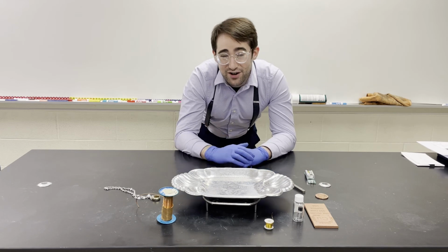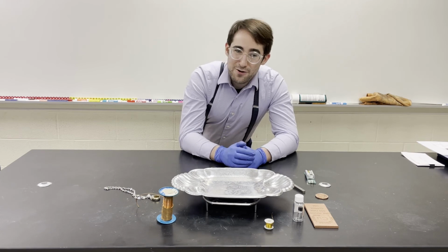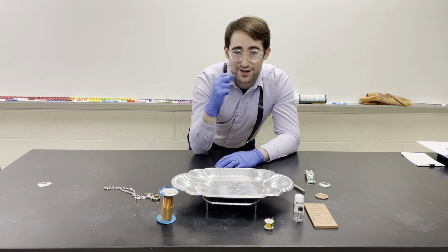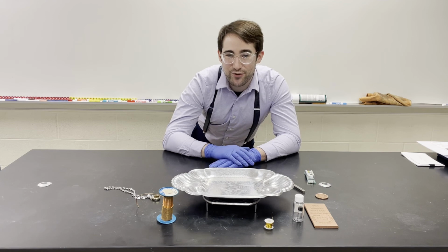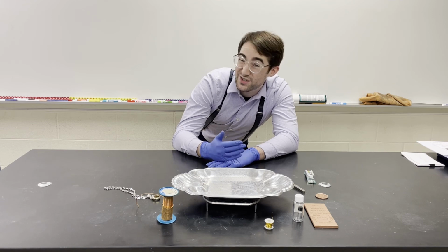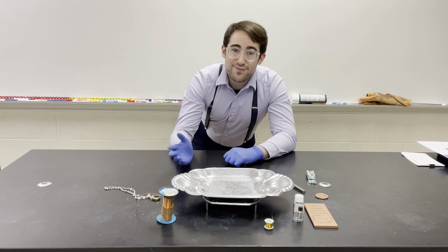Okay, so that means any jars that are open are fair game, as long as you have gloves on. Most of these metals are okay to touch with your bare skin, but there are a couple that are not so much. So we want to minimize contact as much as possible, which is why we're going to be wearing gloves the whole time. So in the lab, you're going to be looking for properties that are characteristics of metals, or stuff that's characteristic of nonmetals, or things that are kind of in between, a little bit of column A, a little bit of column B, and might be metalloids.